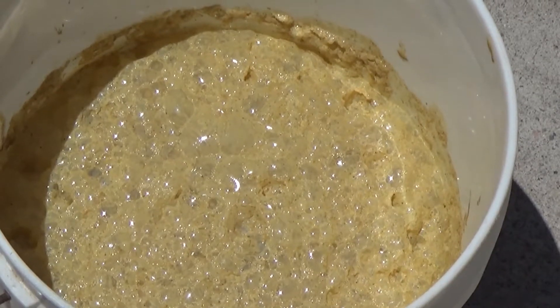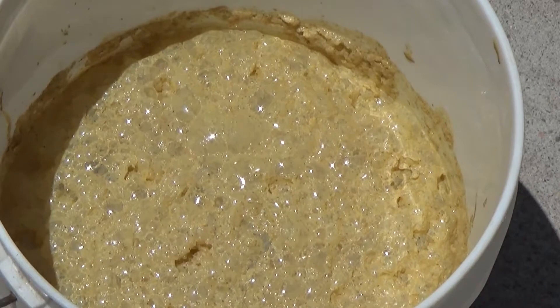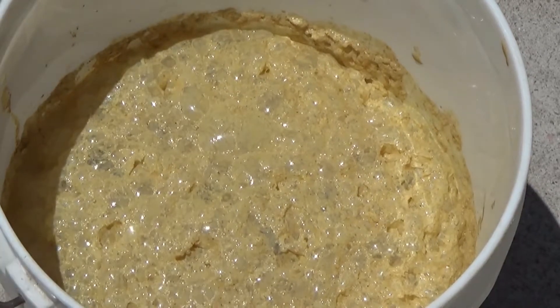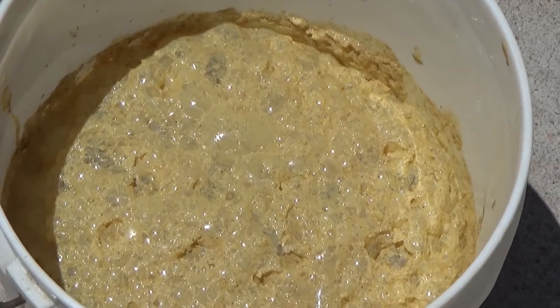We just started up again. As you can see, it's still kind of a golden brown. We'll wait for it to quit working, and then we'll go ahead and put the HCl in it. Sometime tomorrow I'll make a button.